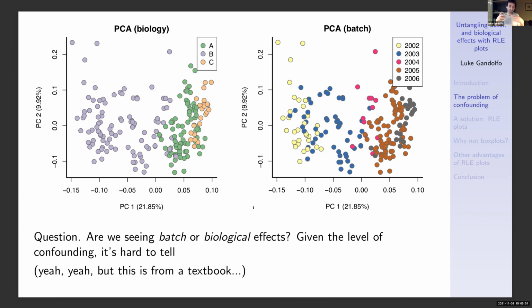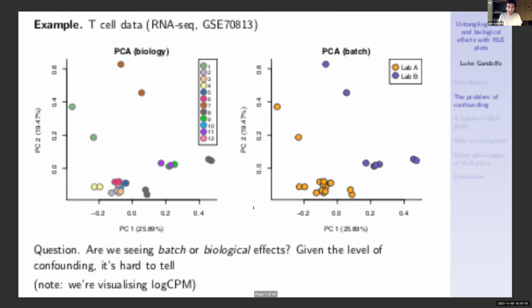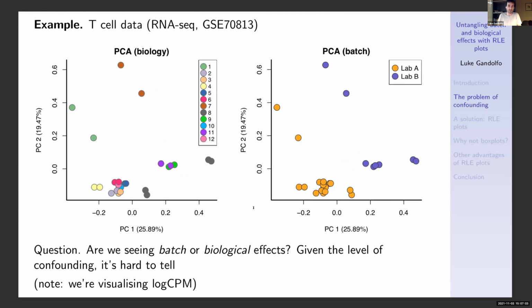And of course, you might be thinking, yeah, come on, this is from a textbook. Of course, they're going to show you a very, very bad example of what I'm trying to point out here. But here's an example that just came up recently, randomly in my own research. It's RNA-seq data on T cells. And when we do a PCA plot of the data, one colored by biology and one colored by batch, in this case, 2 different processing labs, again, we see a high level of confounding.